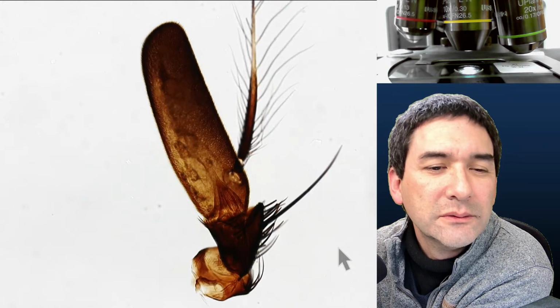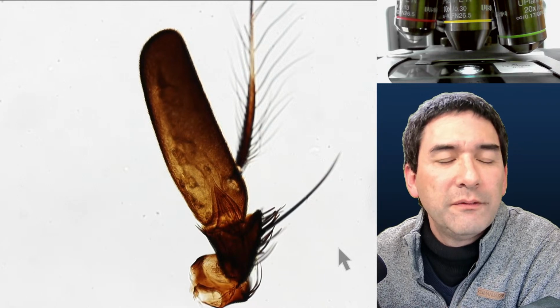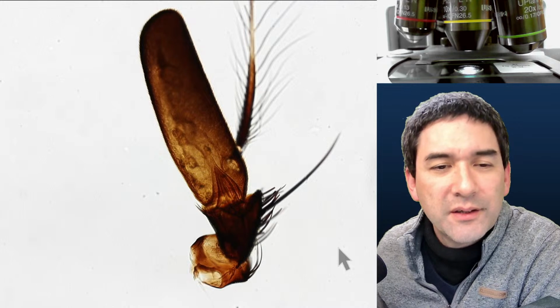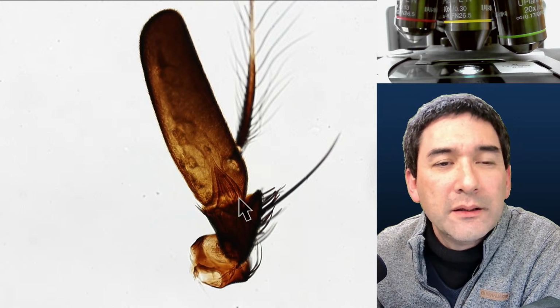Ah, that's the place basically where it was joined. Flies, of course, do not have very large antennae.